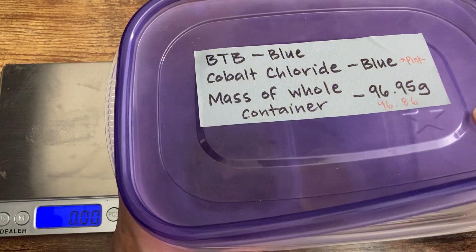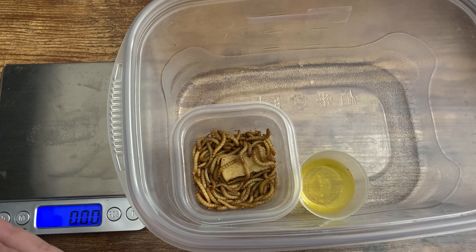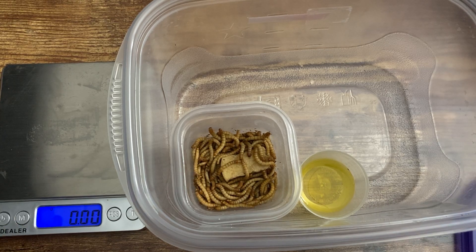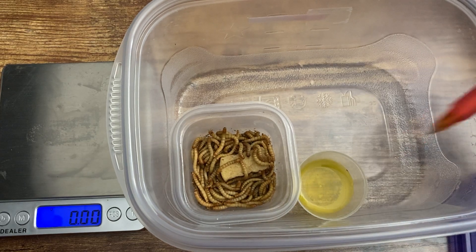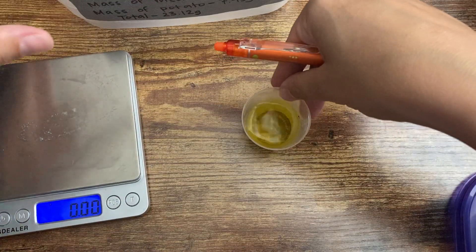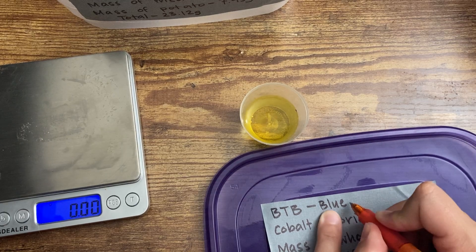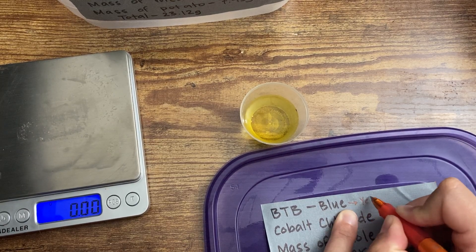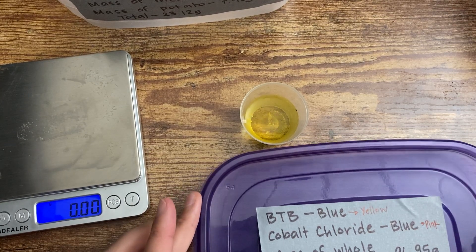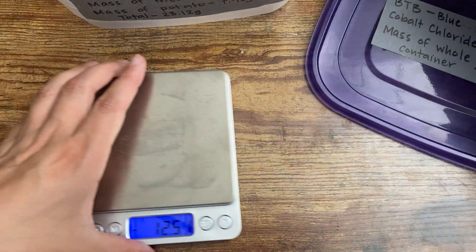Let's open this thing up. My mealworms are in there — they look a little bit bigger to me. And it looks like the BTB has turned to a really bright yellow color. So let's write that down: the BTB started off blue and it has turned to yellow. Those are the pieces of data that we took at the end of the experiment.